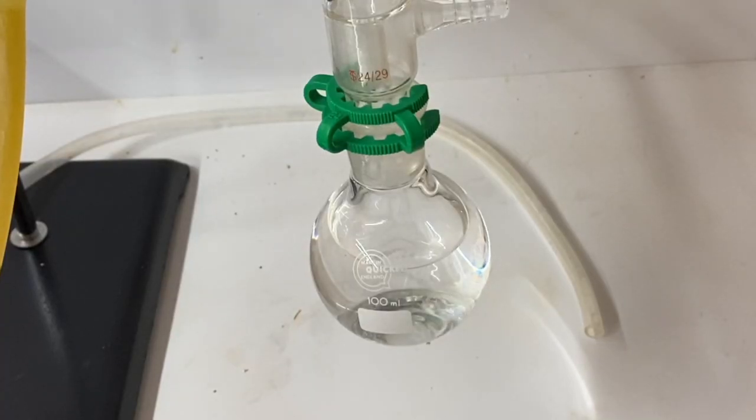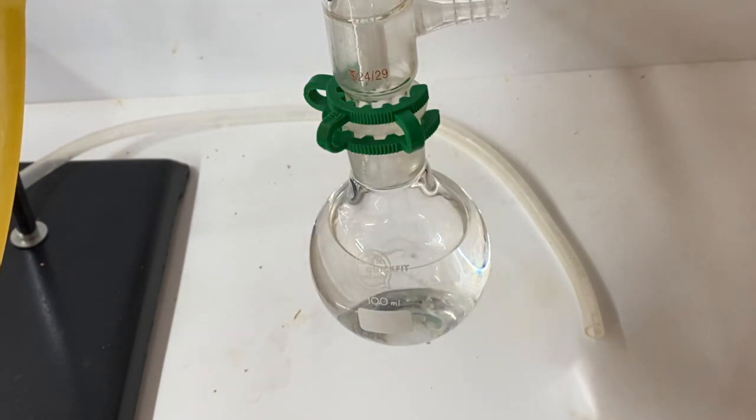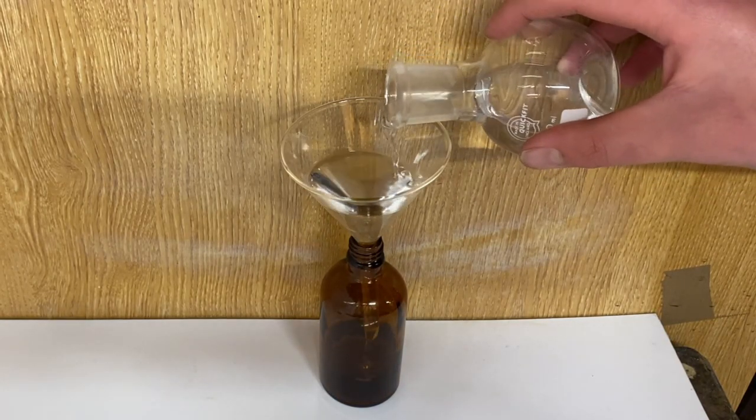After about 15 minutes, I was able to collect my first fraction. To an amber bottle, I added my trimethyl borate.